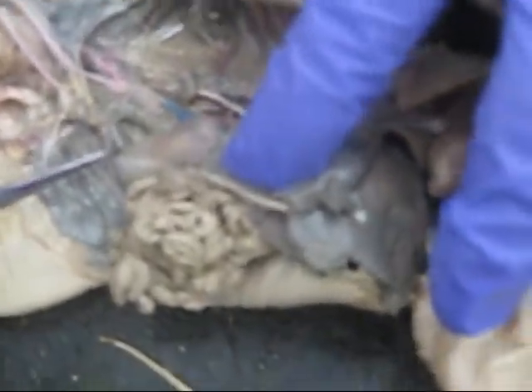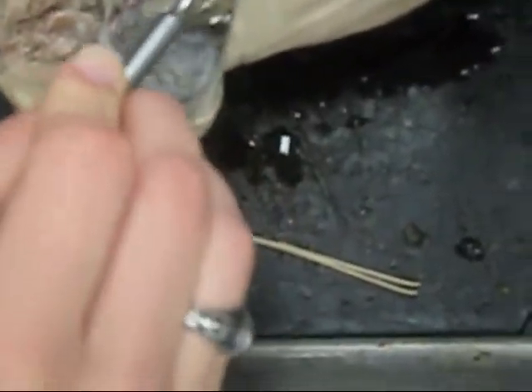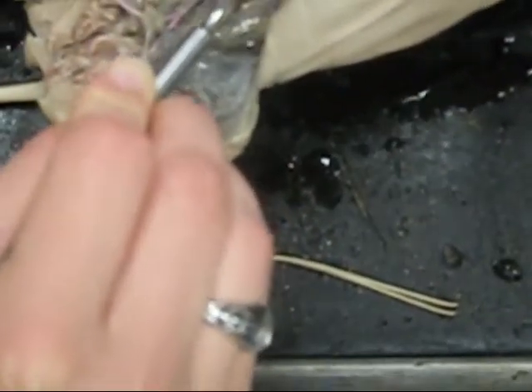I think maybe we should ask the lab assistant to come over. Lindsay? Could you help us find the anterior mesenteric artery? It's actually easier to look at on the other side. You want to look at the aorta and just follow it down. And the first branch off, you see, it's right here. You have to look closely.